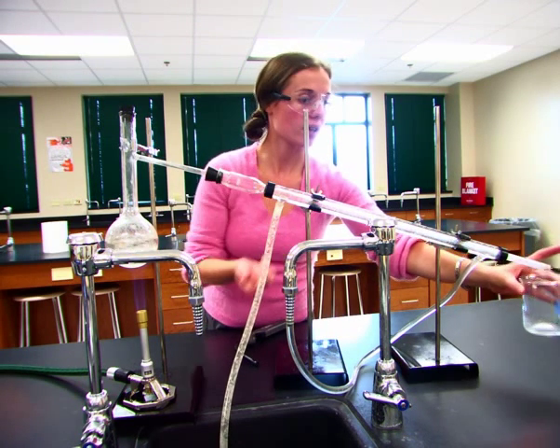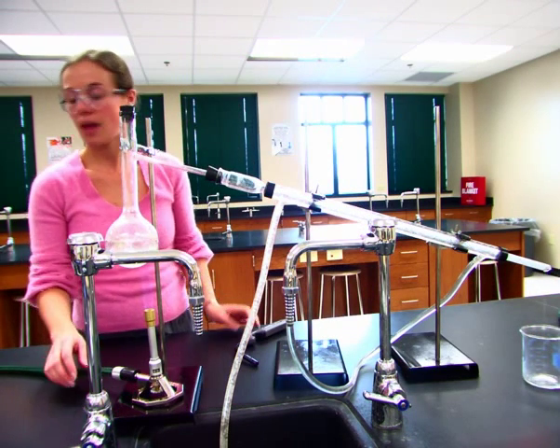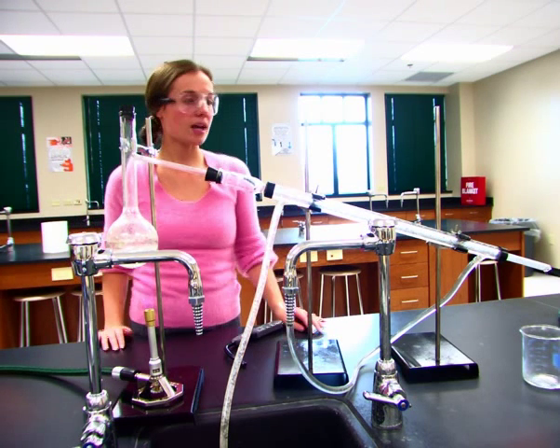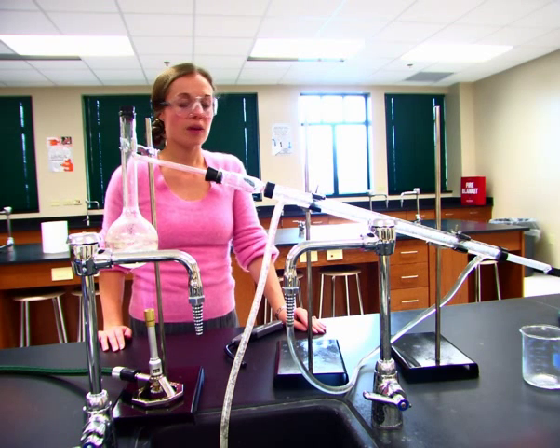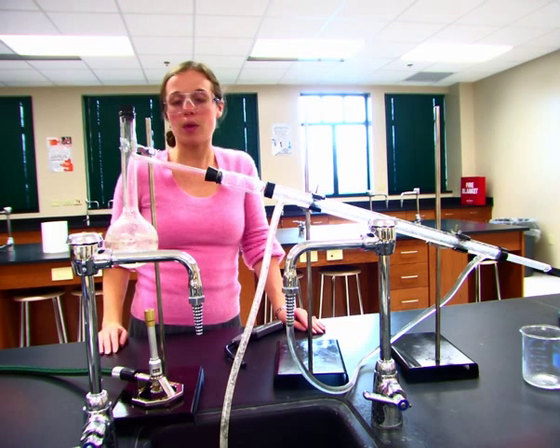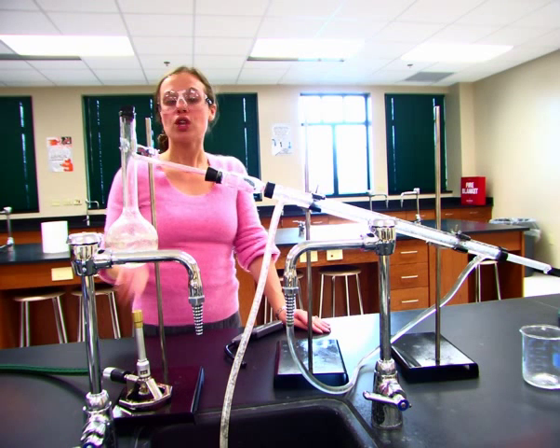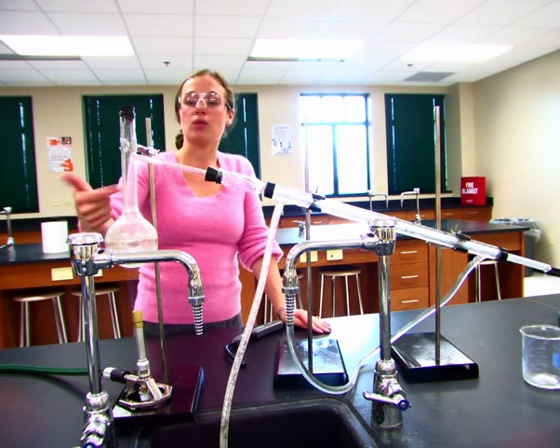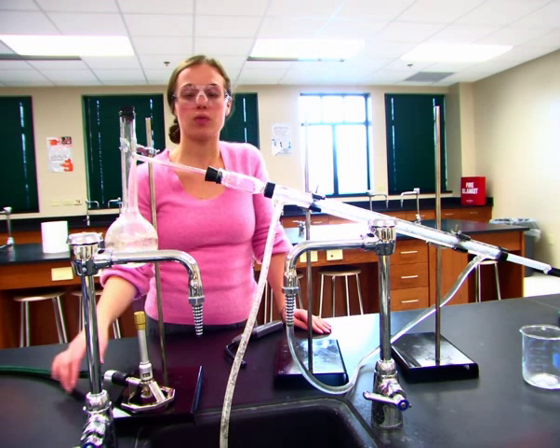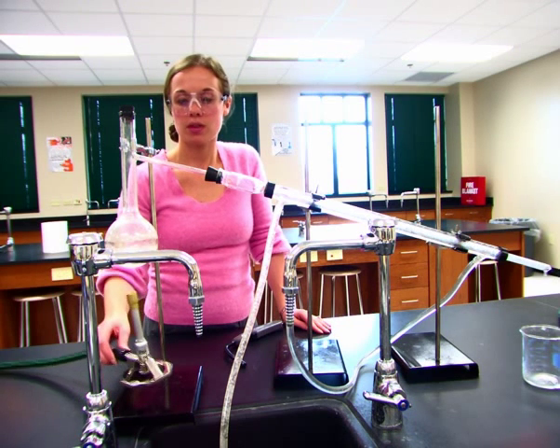And we are just not getting a lot of condensing, but we're really getting a boil going. Some suggestions in class were to maybe use some plastic over a pot as it boils to collect some of that liquid, but really any way that you collect the gas and then cool it down. We also decided that if your ship sunk and you're on a raft, you could use the sun to get this boiling going instead of a gas stove or the engine or something like that.